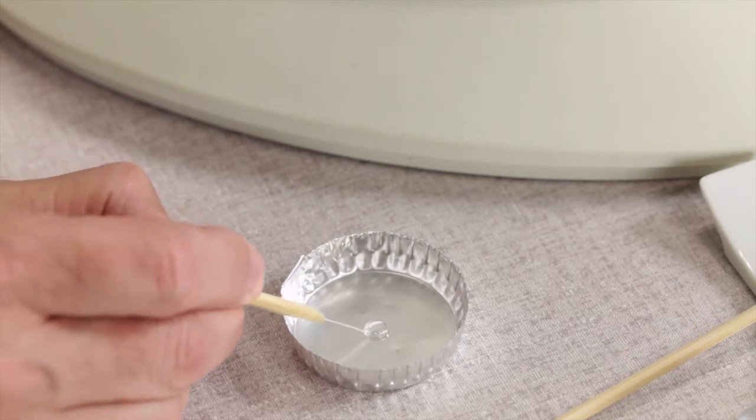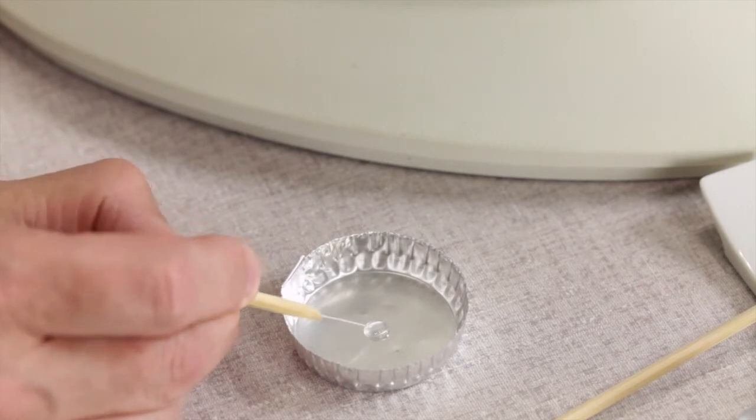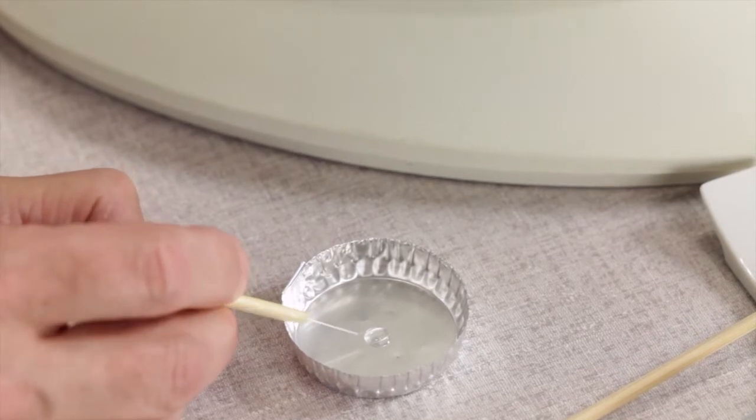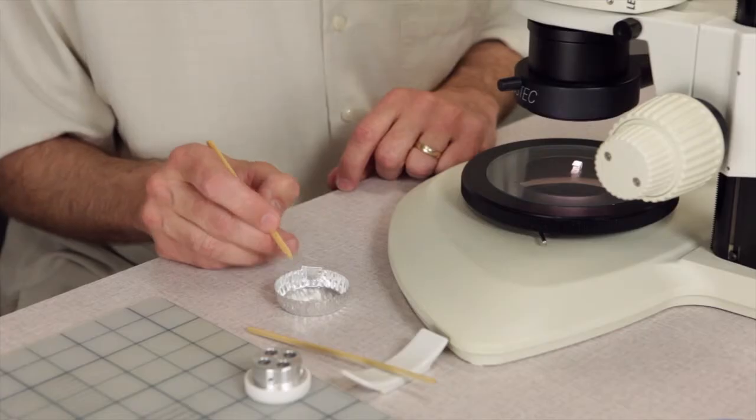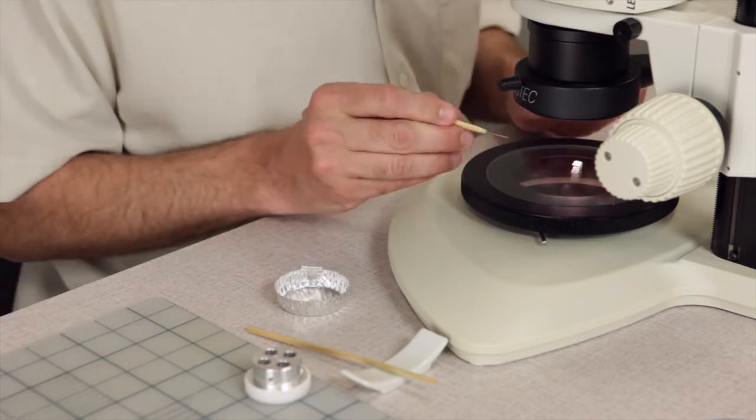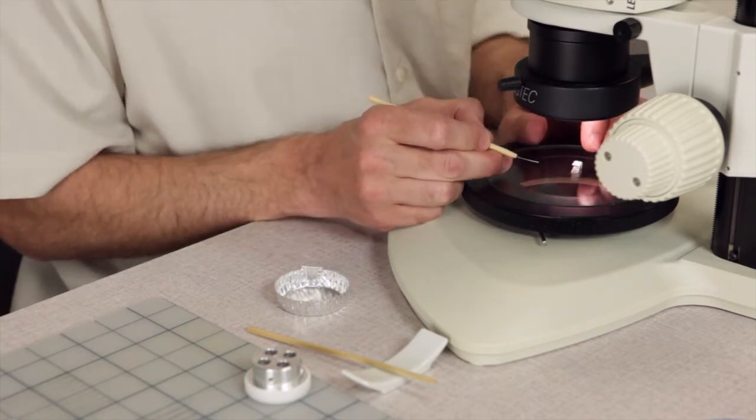I just need to pick up a little bit of cyanoacrylate on the tip, just a little mini droplet, and then I'm going to go over to my sample.